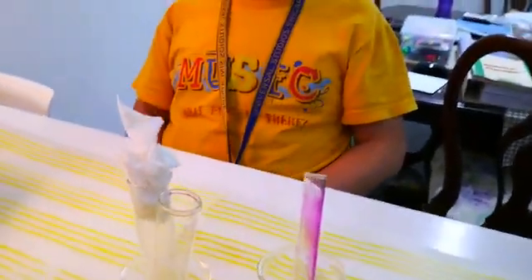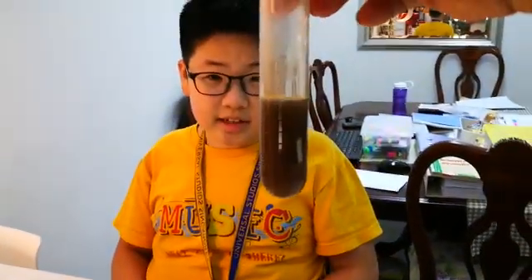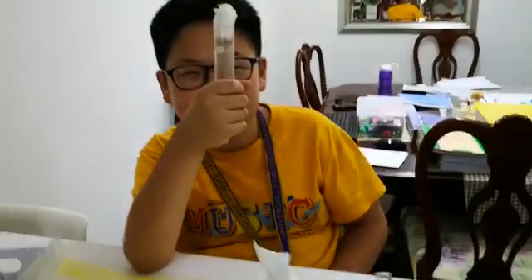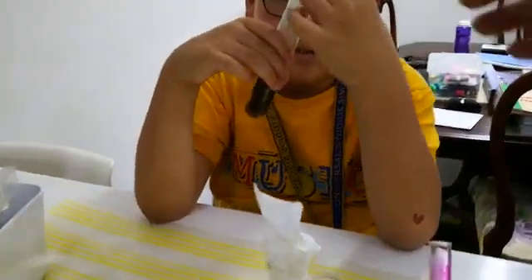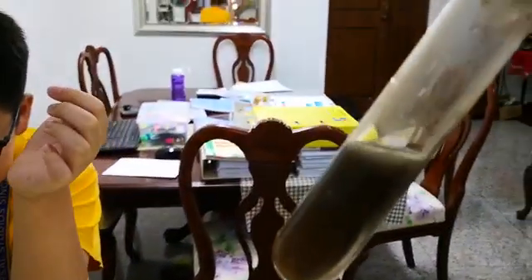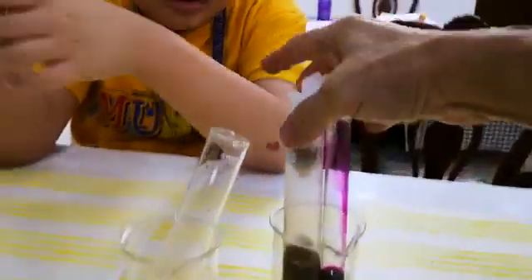And turns it almost colorless. I'll switch off the light — it's like a hand warmer. Because it is exothermic. So it's almost colorless. Is it almost colorless? Yes it is.